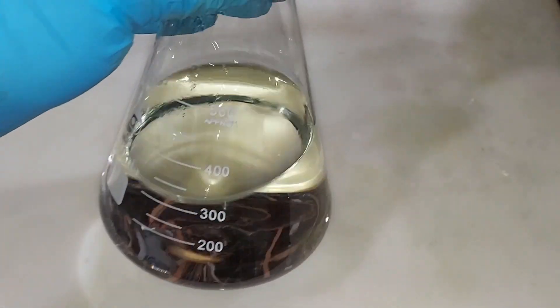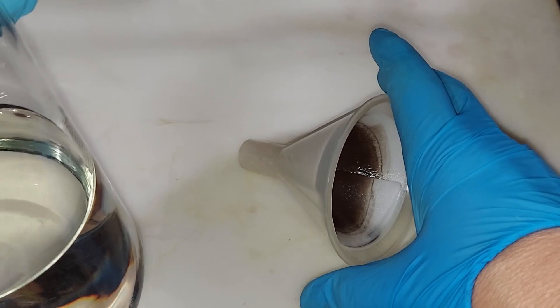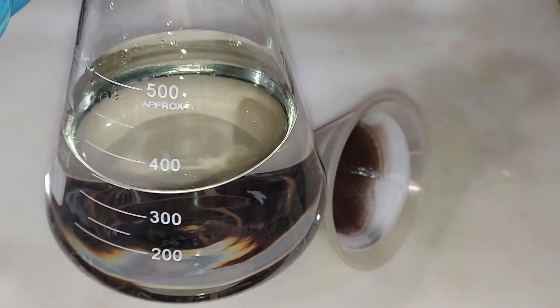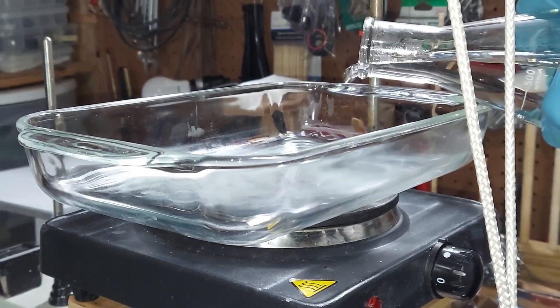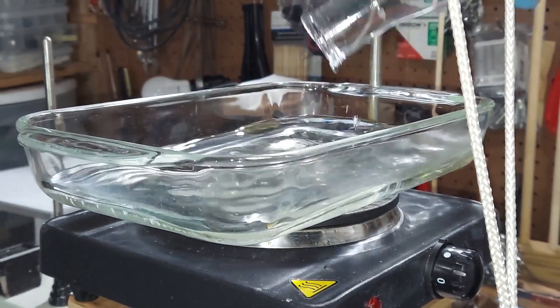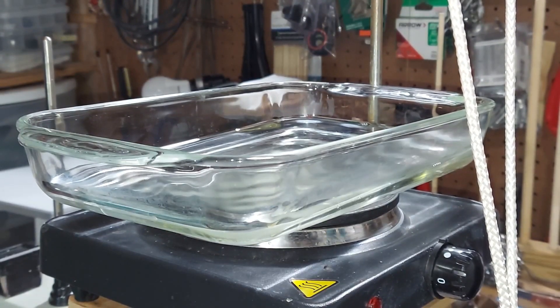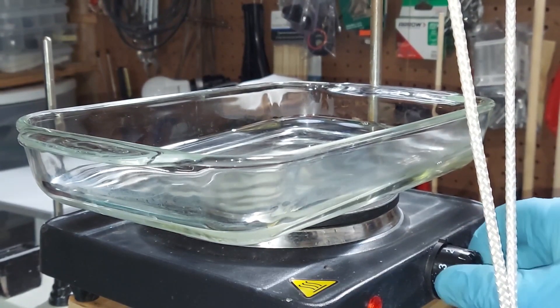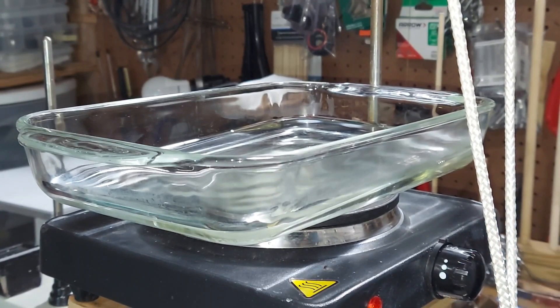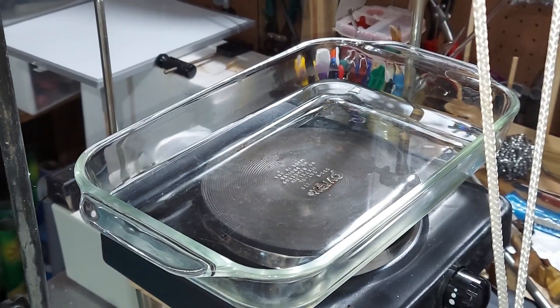The filtering is done. Here's our sodium nitrite solution. I'm going to take off the top of that right there and pour it into a pyrex dish and evaporate the water — pouring our sodium nitrite solution into this large pyrex dish. I'm going to turn the heat way up and we'll get rid of some of that water and scrape out the crystals. This takes a while so I'll be back when it's done.